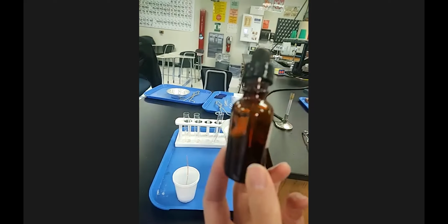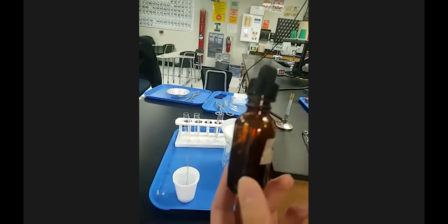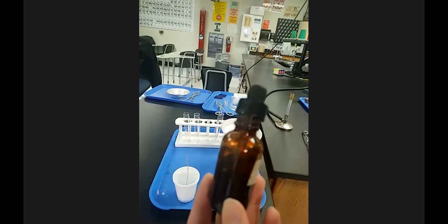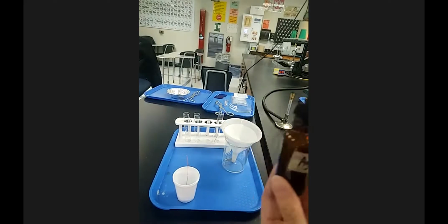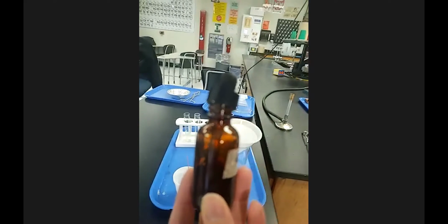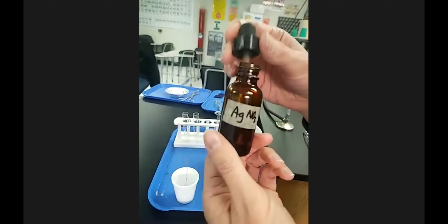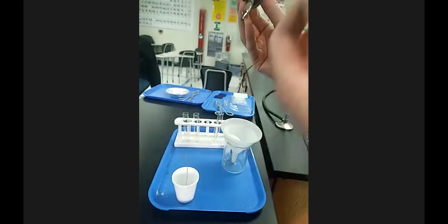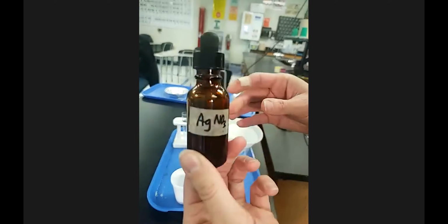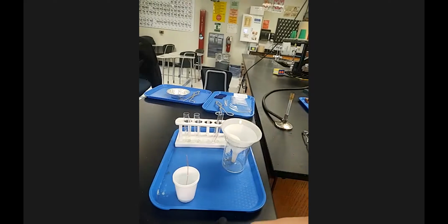Now, all of these, the solids, what's in solution, what's a liquid, everything here is at room temperature. So everything that I will show you as the before, temperature-wise, is going to be all room temperature. Odor, on some of them I'll try to remember if I think that there is a notable odor. The silver nitrate does not have a noticeable odor. I am smelling bleach because I did drop a drop of bleach down. It just smells fresh.